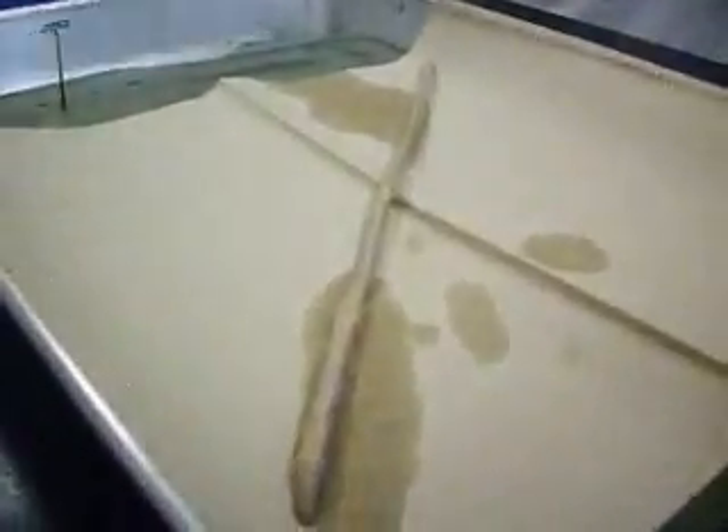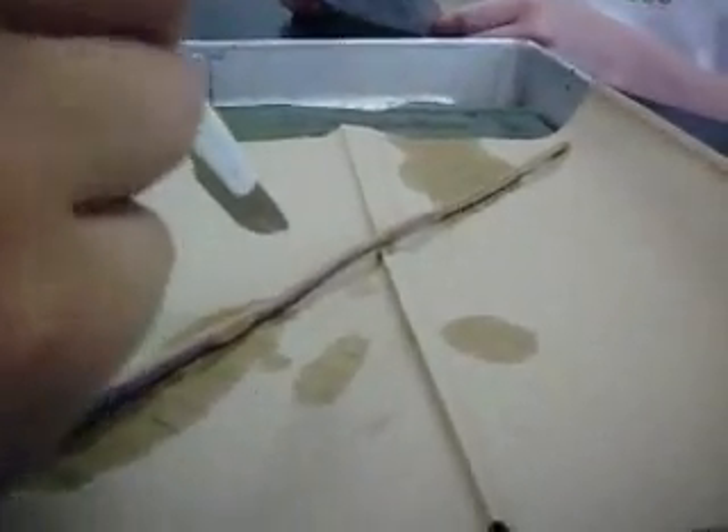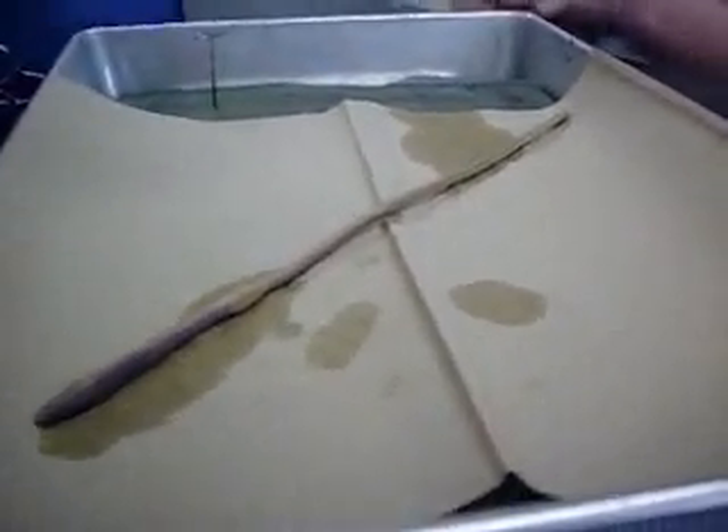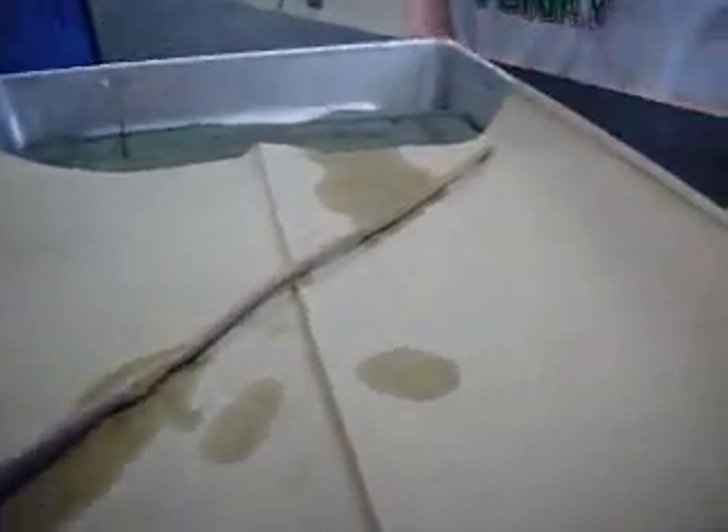Tell us what we're doing today, Katie. We're dissecting an earthworm. Where do we dissect it from? It says to do exactly what you're doing. It says above the clitellum.